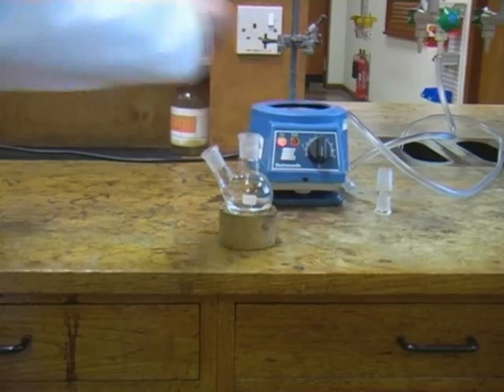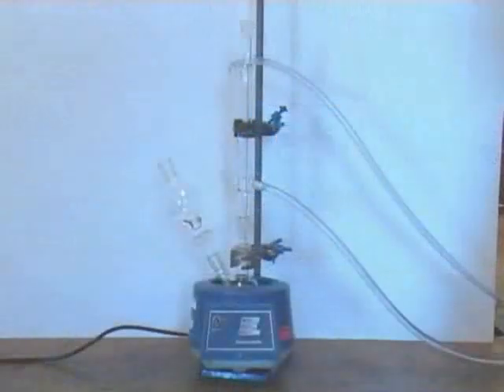As always, anti-bumping granules must be added for safety reasons. And now we can fully assemble our apparatus.